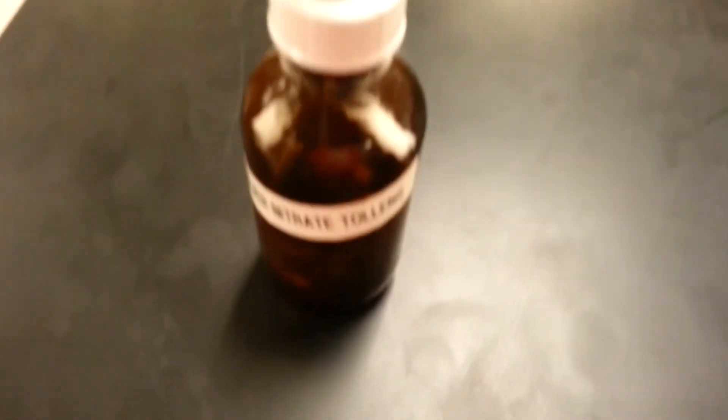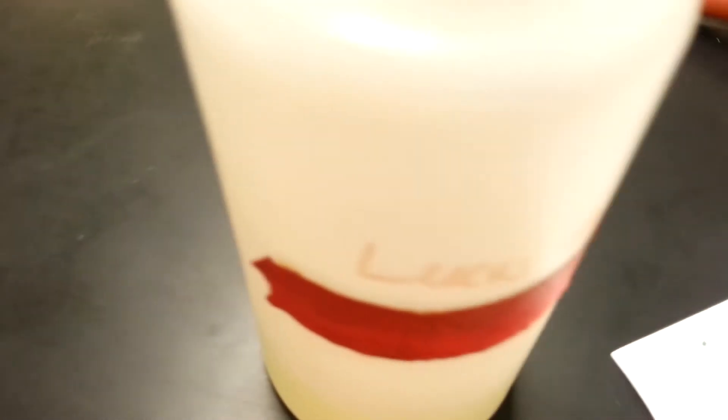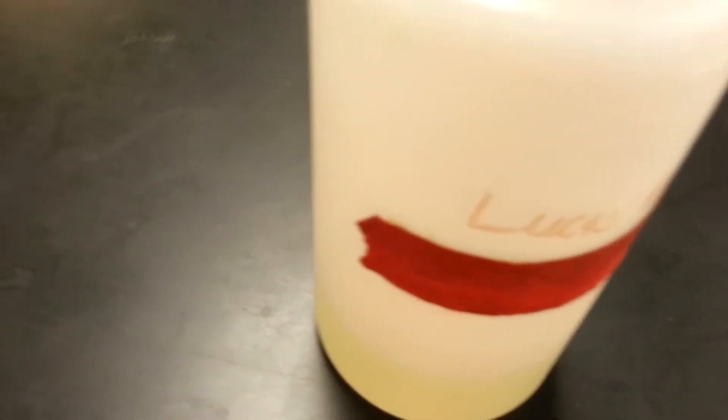The next one is of course going to be Lucas Reagent, which is right here. I don't have everything like memorized off the top of my head, I do know because I have to make these things, but you still have to look up the stuff though.